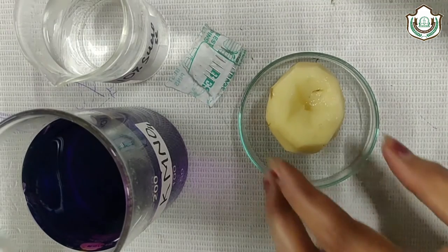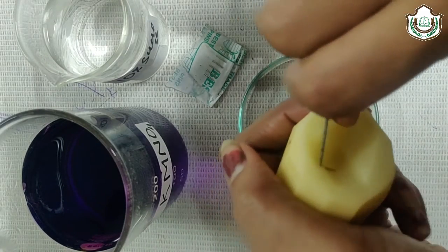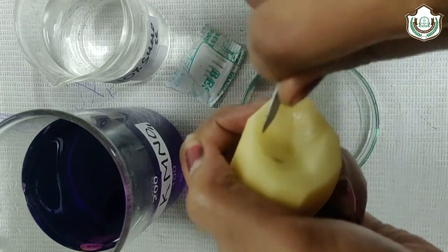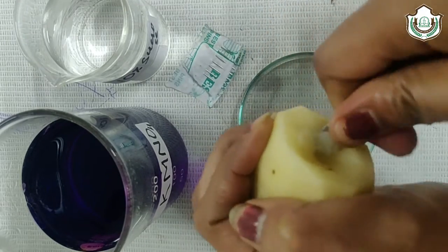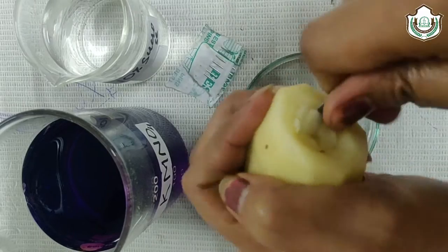Now you have to make the wall thin with the help of scalpel like this.